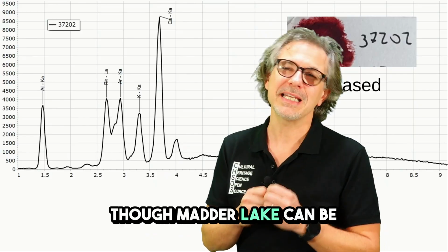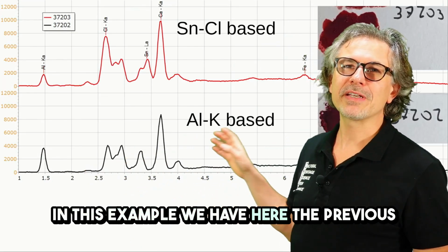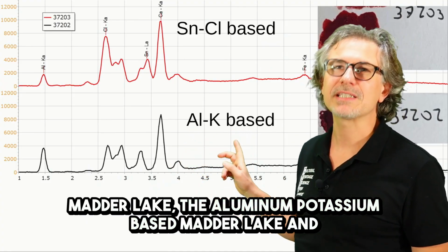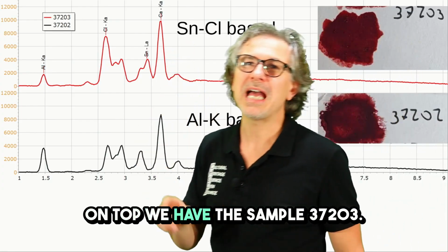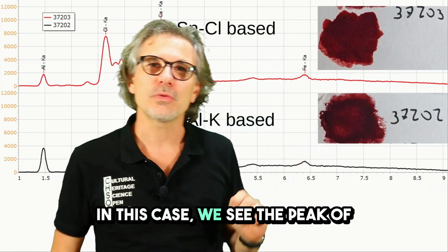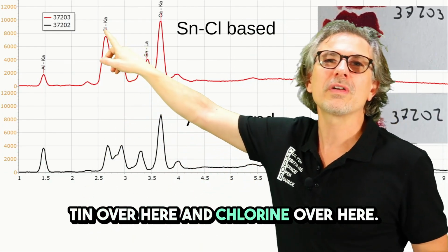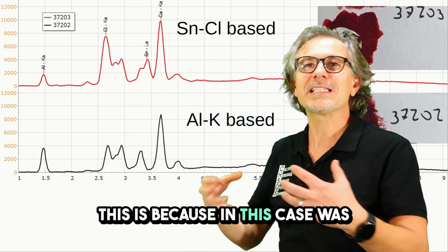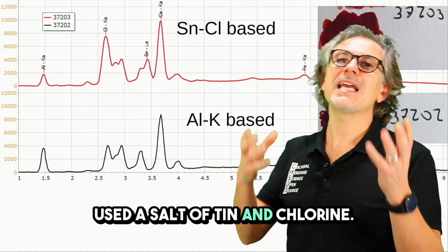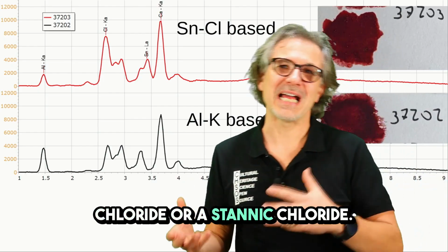Though Madder Lake can be made with different solutions. In this example, we have here the previous Madder Lake, the aluminum potassium based Madder Lake, and on top we have sample 37203. In this case we see the peak of tin over here and chlorine over here. This is because in this case a salt of tin and chlorine was used. So basically it will be a stannous chloride or a stannic chloride.